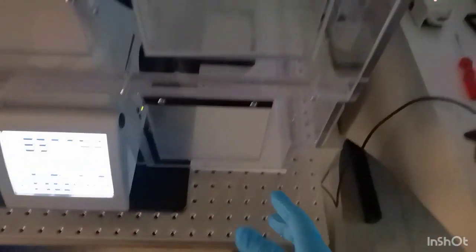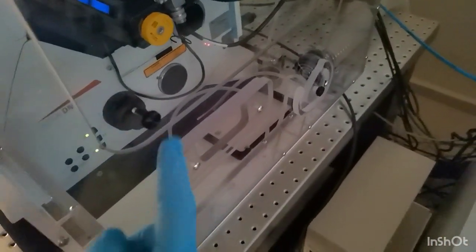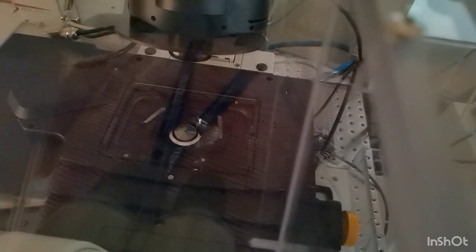The cleaning solution has some hexane and isopropanol in it, I think, and then we gently push and wipe with the cloth that we have. You have to be gentle, but you have to clean the oil thoroughly, because oil becomes very messy, so you need to be sure to clean it properly.